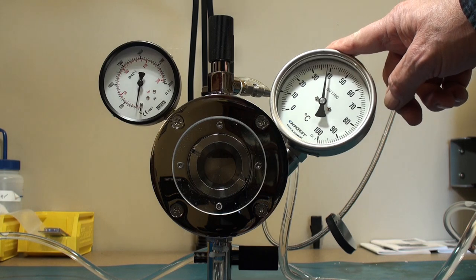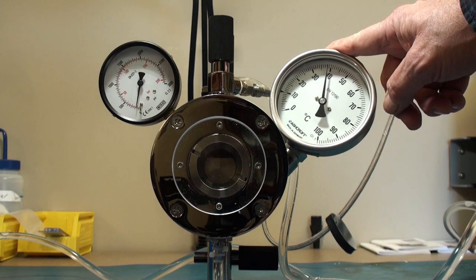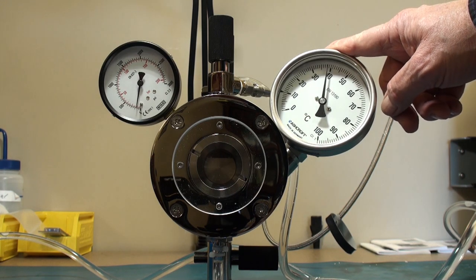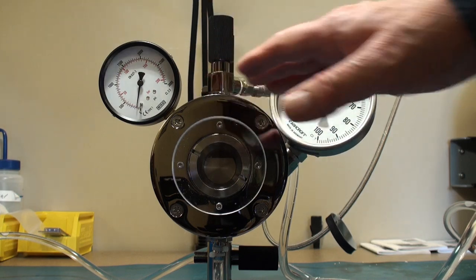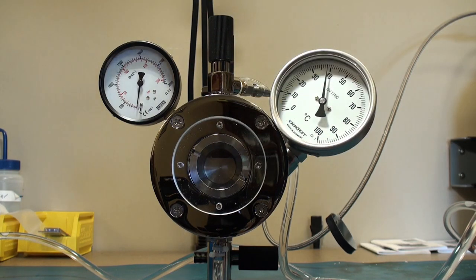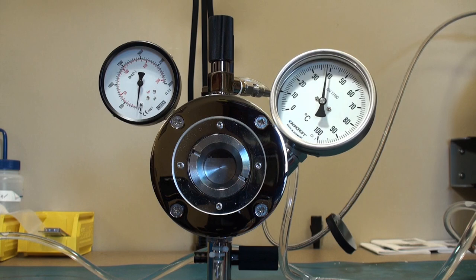Notice the temperature is still well above the critical temperature, 31.5 Celsius. You always want to be sure to warm to the end.